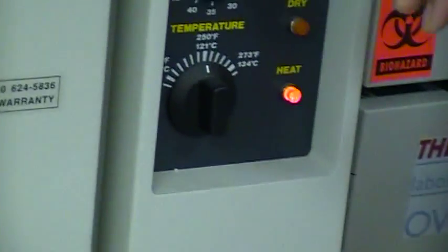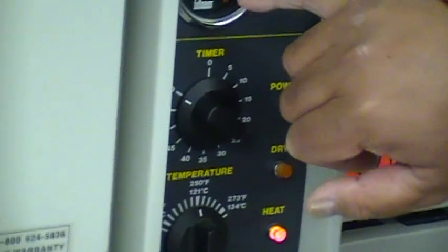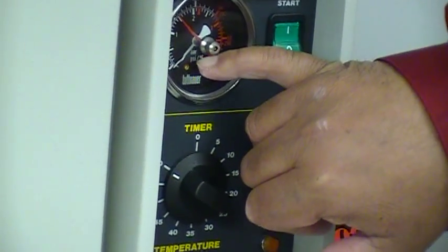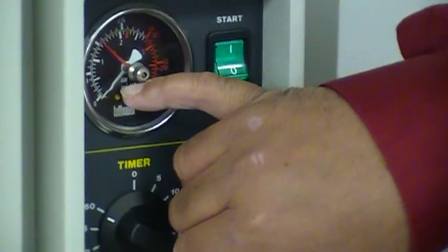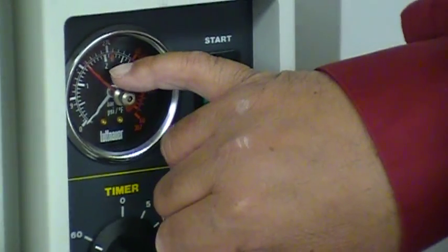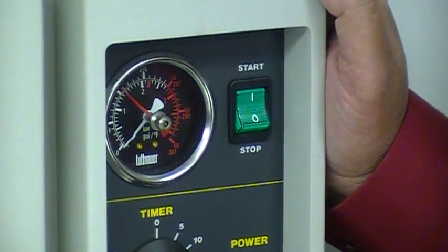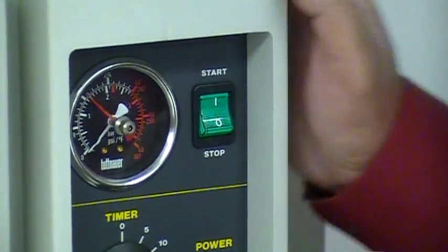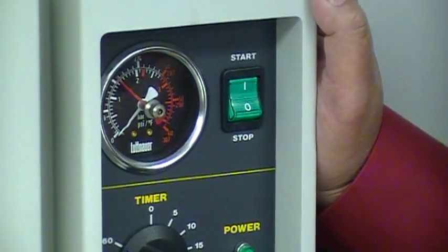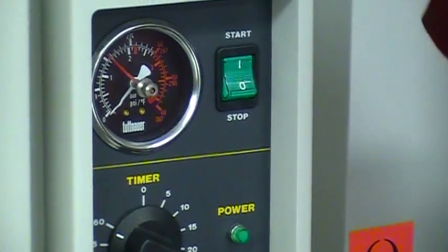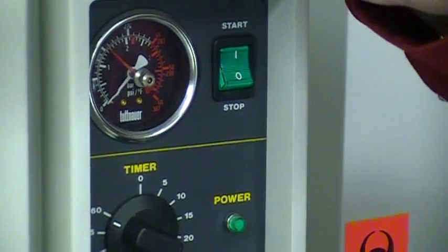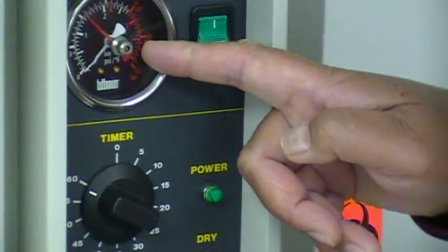After a while, if you come back, you're going to see that the white clock hand is going to go up to meet the red clock hand. That indicator is for the internal chamber pressure. When you come back, at the end of one hour, that thing is going to begin to decrease. It's going to begin to come back down to zero.